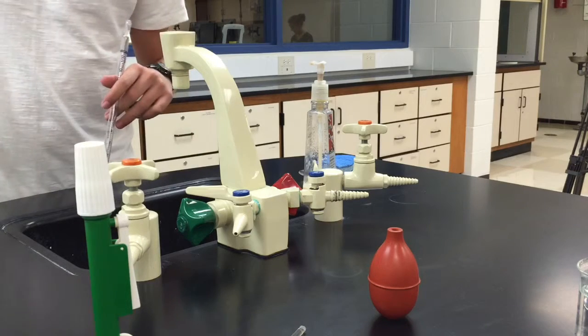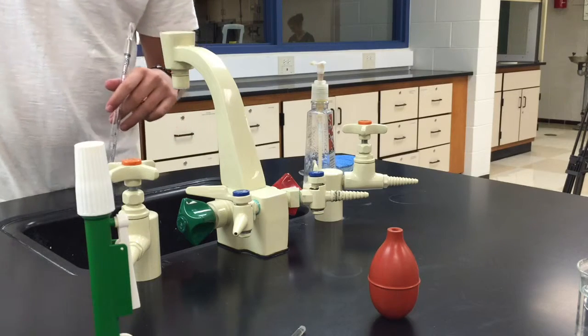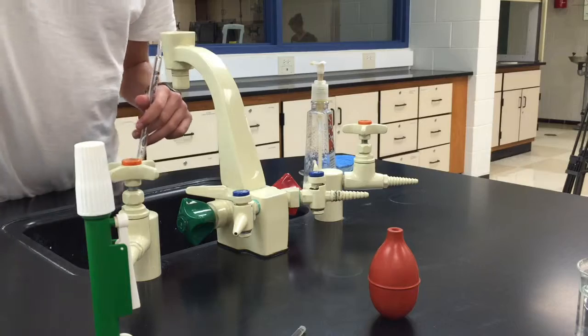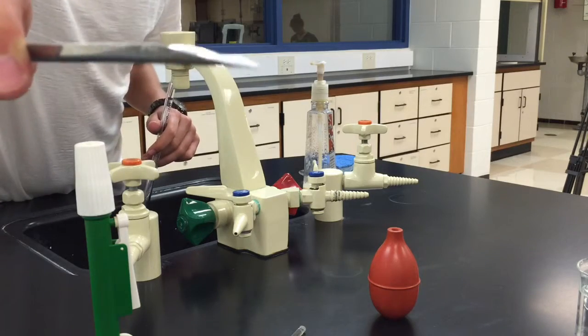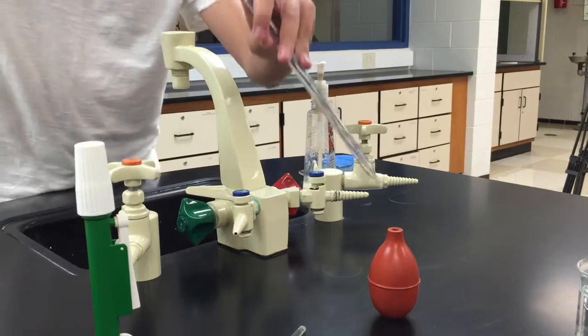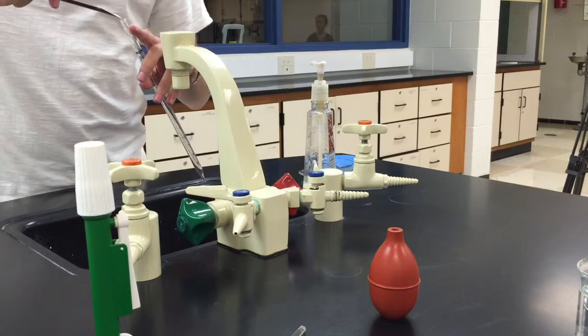With this size pipette, you just want a minimal amount, something kind of close to that. You're going to take it, put it in the pipette over the sink, of course.